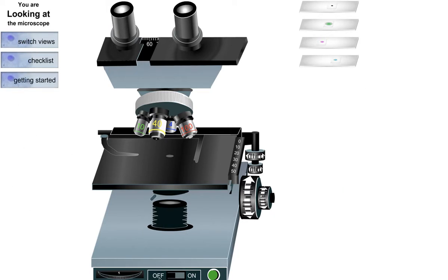Okay, so the first thing you want to do is to turn it on here. And then turn this button over here. And then this is the intensity. I think they only have two intensities, 1 and 10. So you can start at 10. You might want to switch back and forth as you go along. And then you can grab any slide. So this is the letter E. So we can start with this. And I think you just drag it, or it kind of half figures out where you want to go.